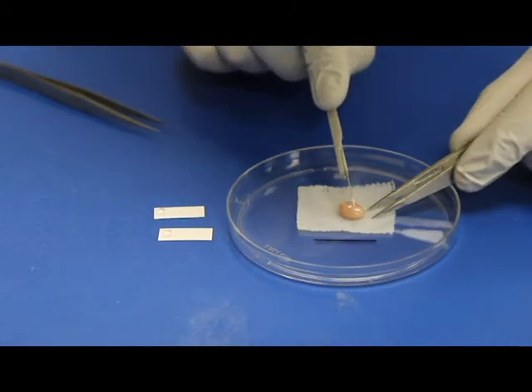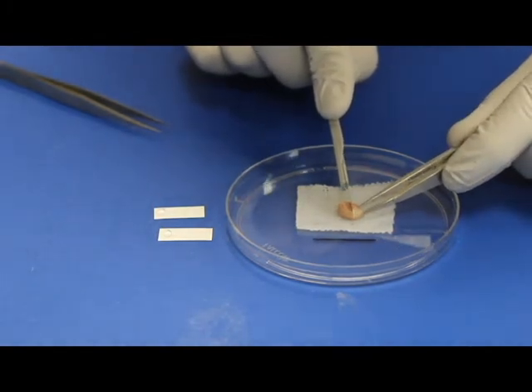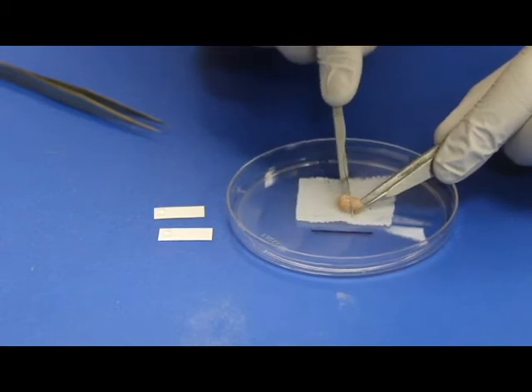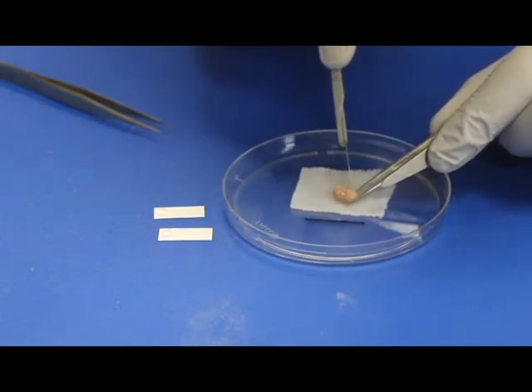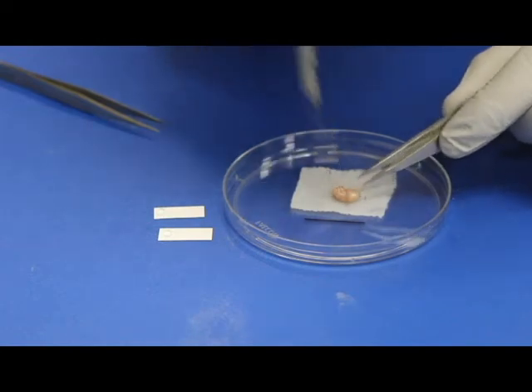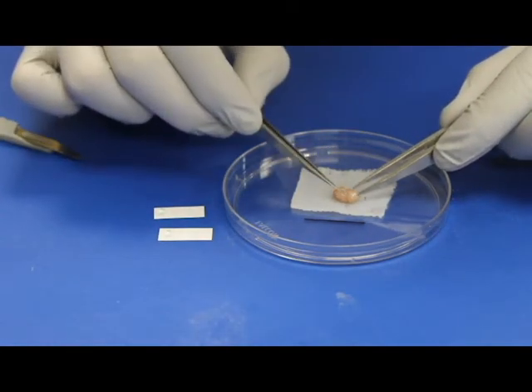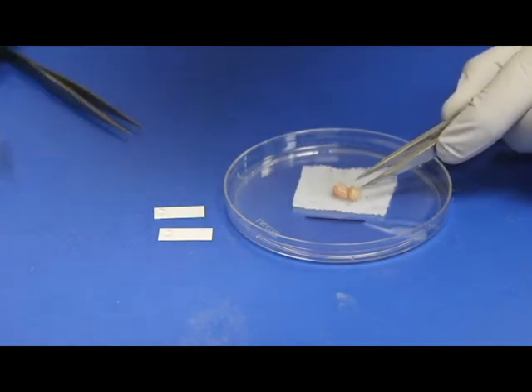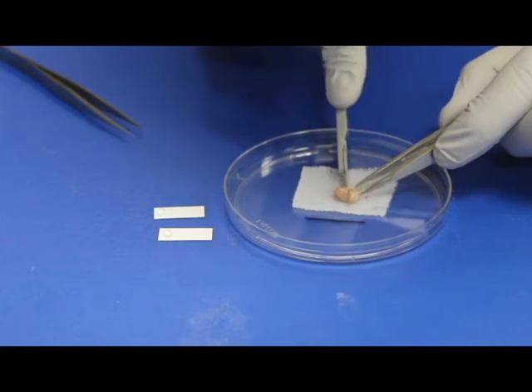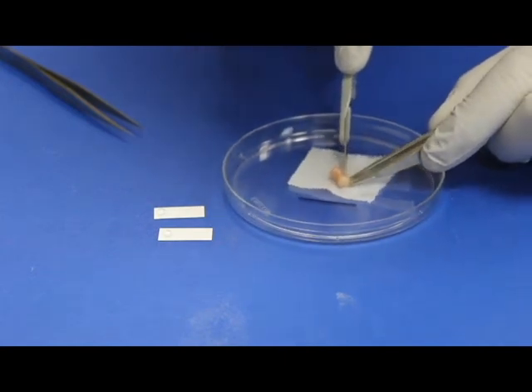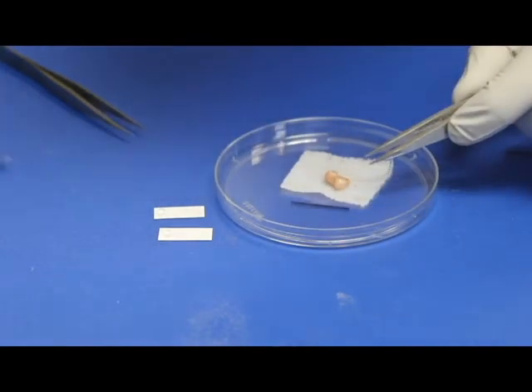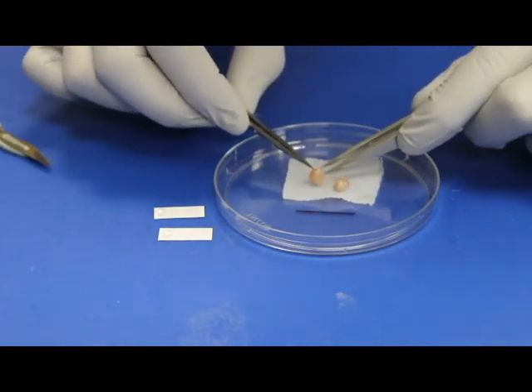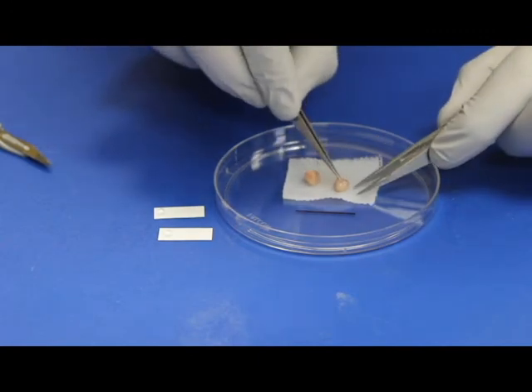Now, keeping track of orientation of the muscle sample, take your scalpel and cut the 1cm side of the biopsy at the middle. The center cut defines the face of the biopsy, where the sample will then be placed face down in the OCT.